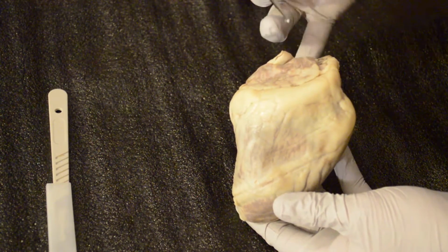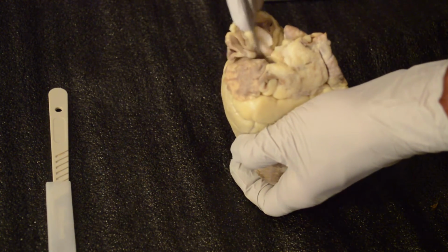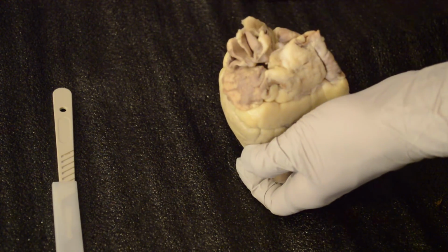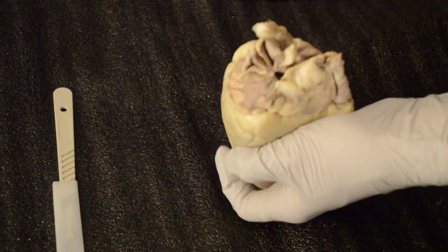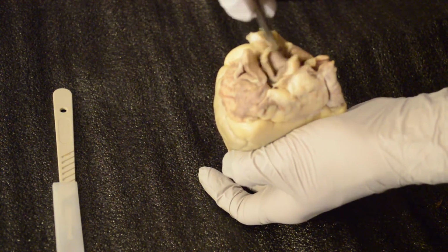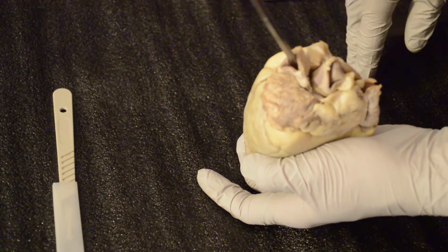Okay. And then going to the aorta. The aorta has a couple different parts to it, actually. We'll look at it from the posterior side more so. But here inside is going to be your aortic arch, and you're going to have your three branches. You're going to have your brachiocephalic artery, which is going to be right here. Brachiocephalic artery, right there. Your left common carotid, right there. Subclavian, right there. Okay, very good.